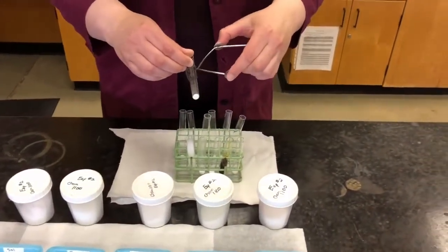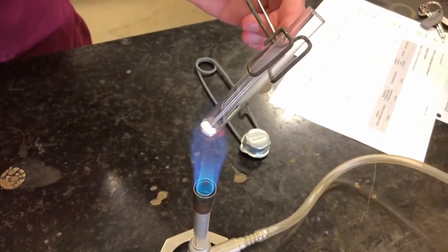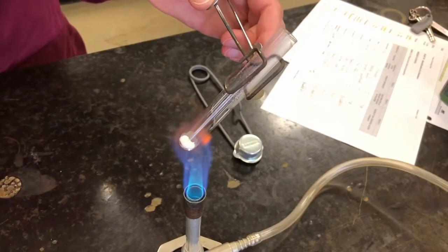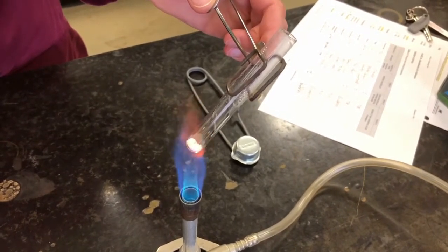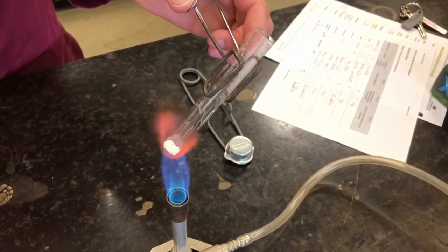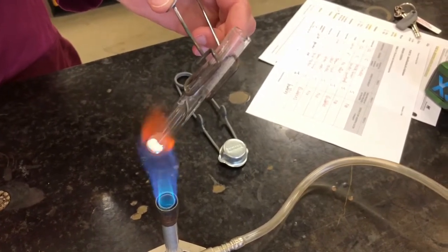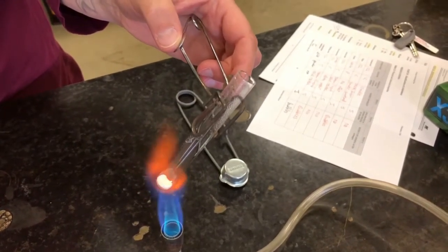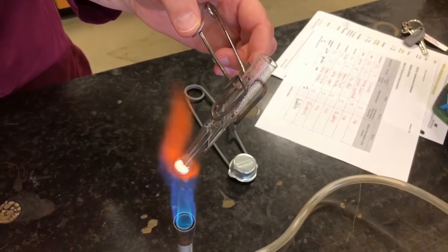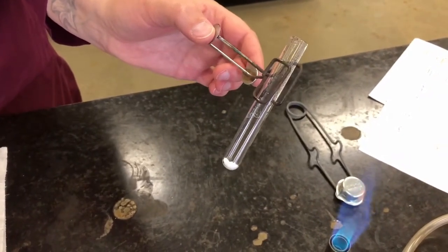And finally, we have our washing soda. Let's put that one in the flame. Let it heat up, and you should be able to see some condensation forming, similar to what we saw with the Epsom salts. So it's also giving off steam. It's similar to the Epsom salts, but we don't get as much steam being given off, though we still get some condensation forming. And the solid again at the bottom has sort of solidified. So we have a solid residue at the bottom of the test tube and steam being released.